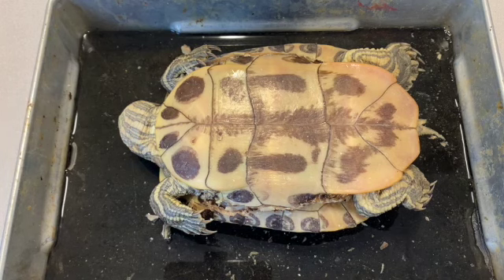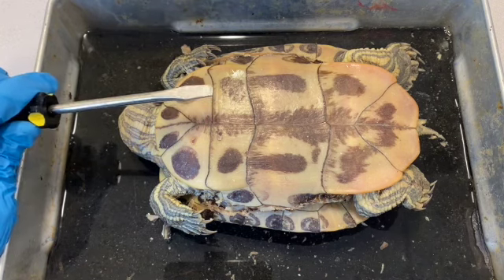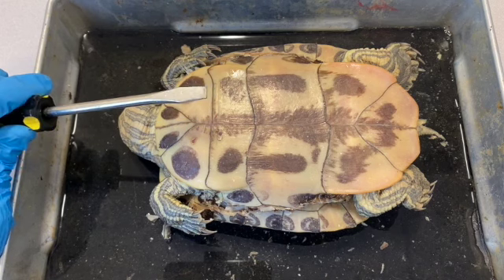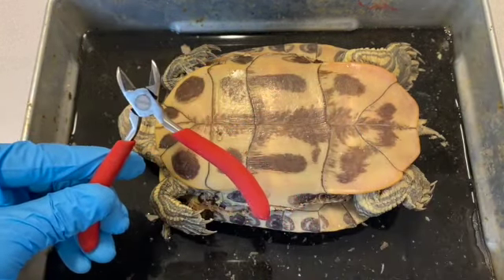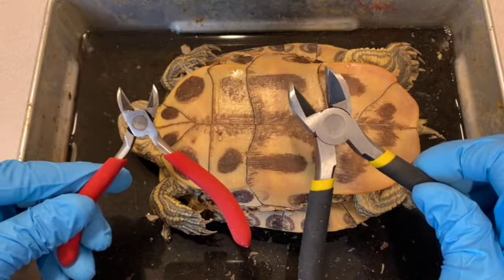Just to let you know, some of the tools that I use when I do this: a broad-bladed screwdriver, which you can insert into the cut and provide some leverage to help open up the cut a little bit. Some bone cutters. You'll need something that heavy duty. If you don't happen to have dedicated bone cutters, you can use other tools. For example, a pair of small and large side cutters can be used to cut through the bony material.